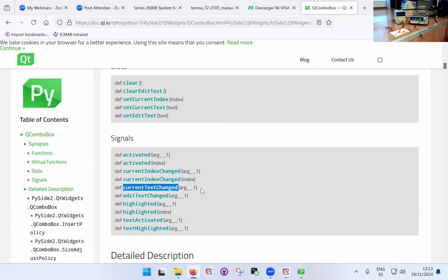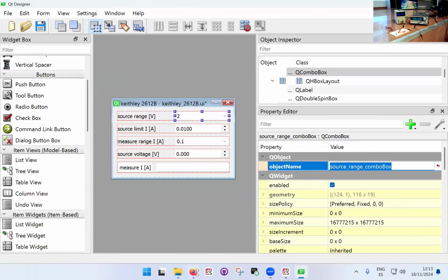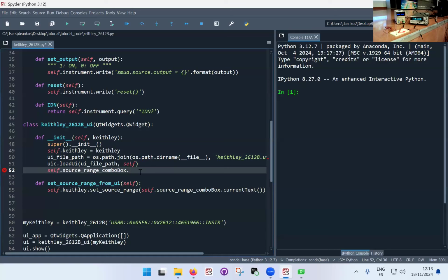So current text change, I'm going to copy this and put it in the code. Dot currentTextChanged dot connect, and this is the keyword that I need to use. Dot connect to what? The function that updates the Keithley setting. Okay, so self dot source range set source range from UI.